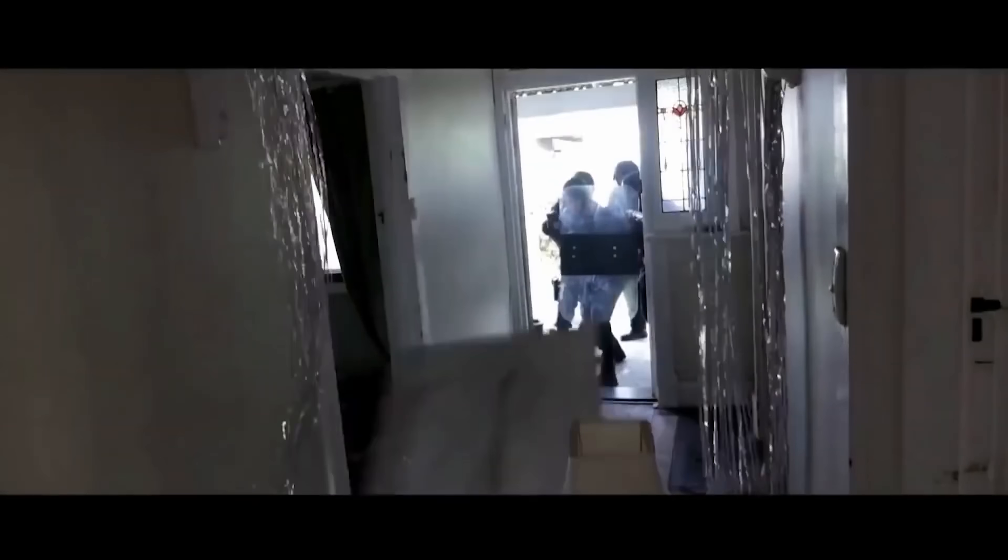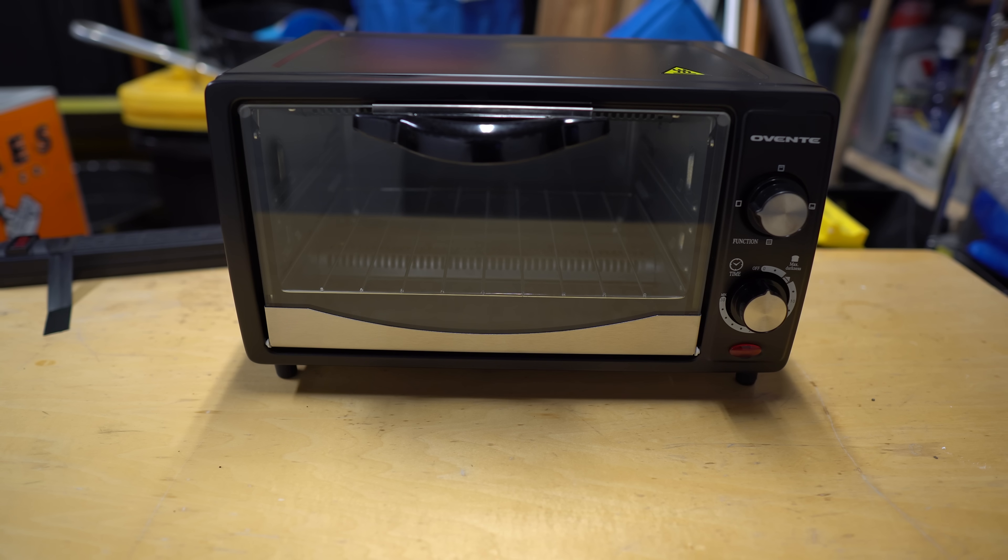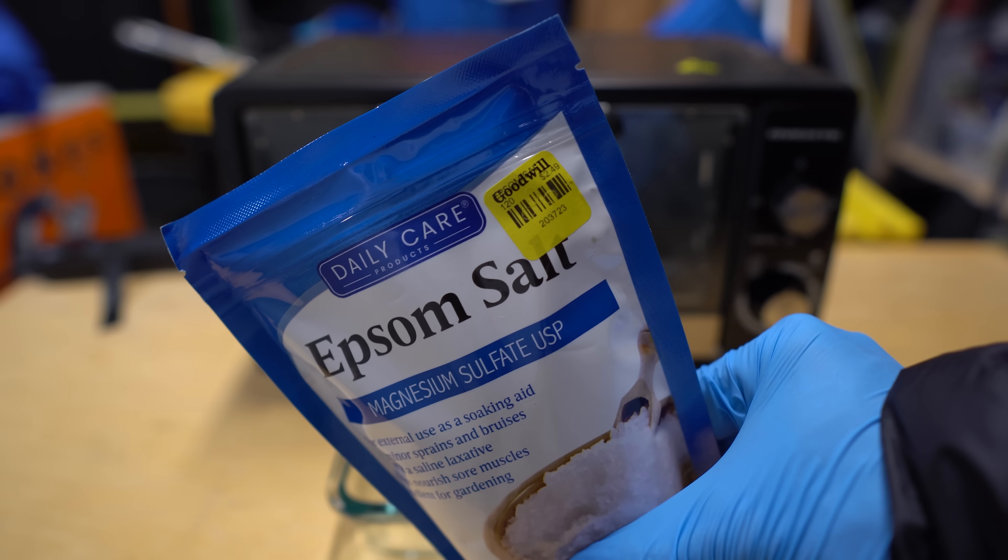Today, we'll be making chloroform. FBI, open up! I've been having trouble sleeping lately, so I thought, well, maybe I can use this to help me.